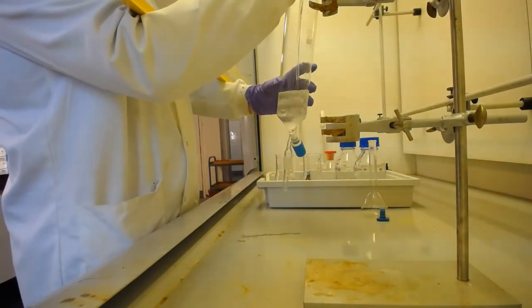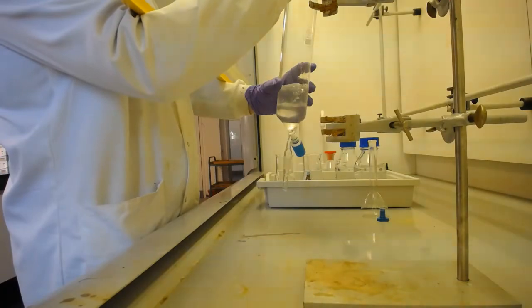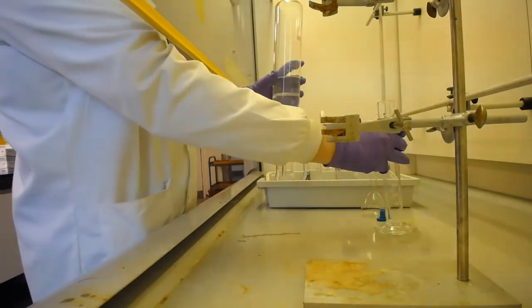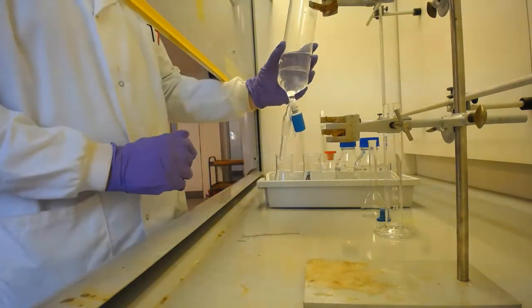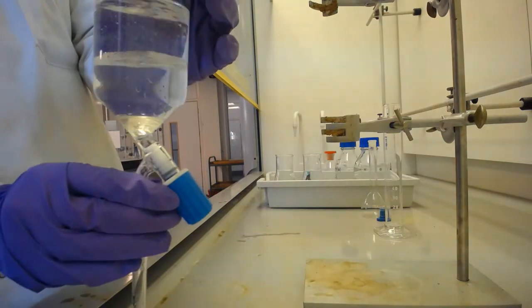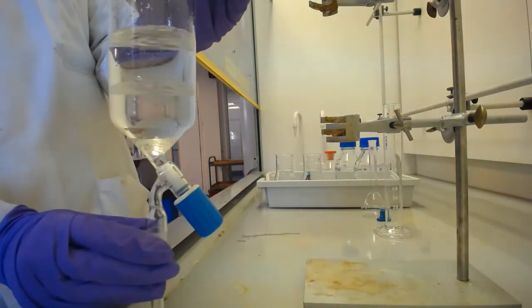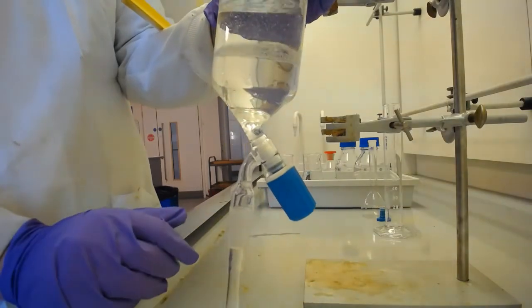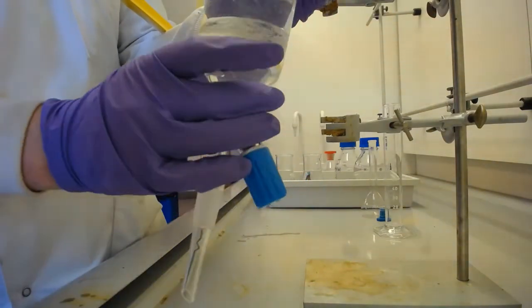So this is a really good point to note which is on top, the water or the DCM, if you don't want to have to look up the specific densities of it, to make sure you tap off the right ones. So hopefully you can see there we've got two distinct layers. I think that's pretty clear. And we've got the DCM and the water.